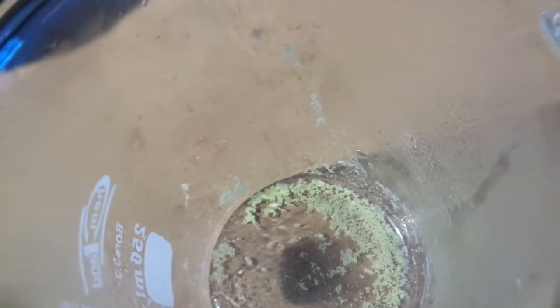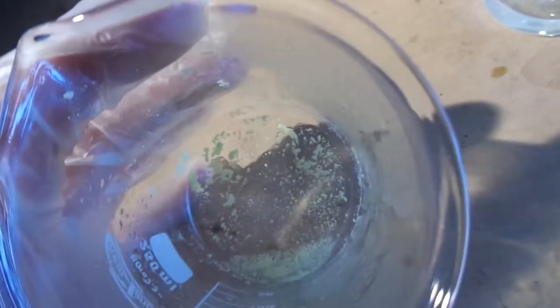Now I'm going to do some tests with the iodoform and see if it can actually evaporate and crystallize like iodine. I'm going to heat it up. After heating it up, it turned orange from yellow, which is kind of interesting.